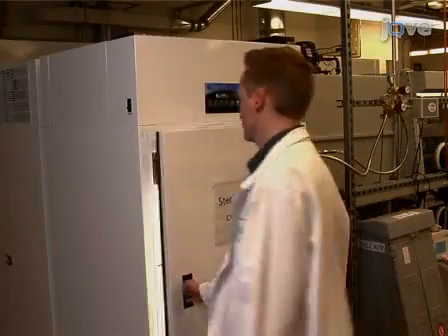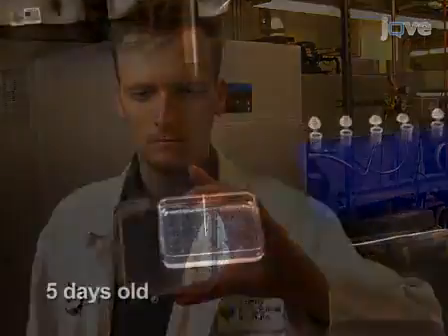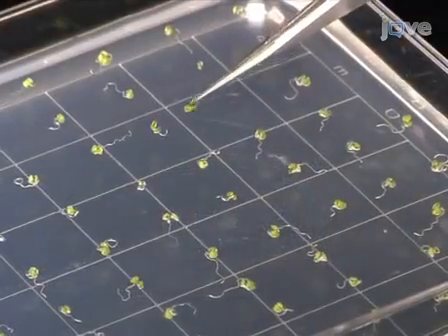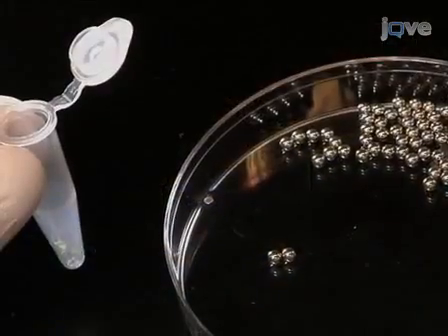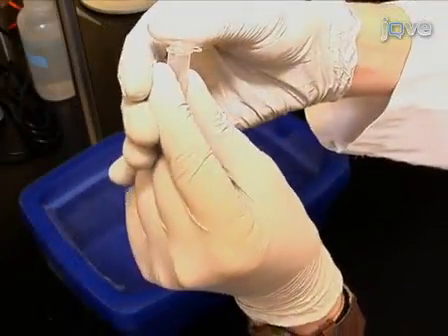Begin this procedure by isolating the extracellular matrix or cell wall of plant tissues. Harvest 5 Arabidopsis seedlings, or the equivalent amount of other plant material, and transfer them into a 1.5 milliliter reaction tube. Make sure that the material is placed at the bottom of the tube. Add 2 3 mm metal balls to the reaction tube and snap freeze in liquid nitrogen.